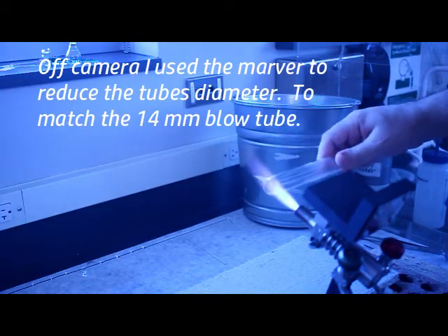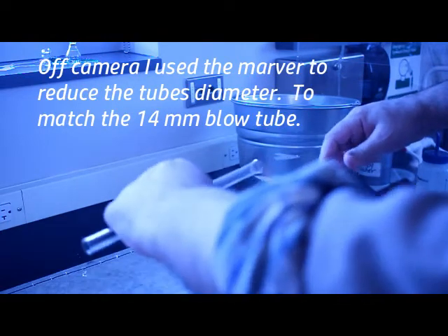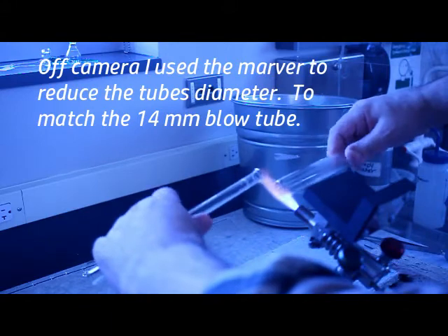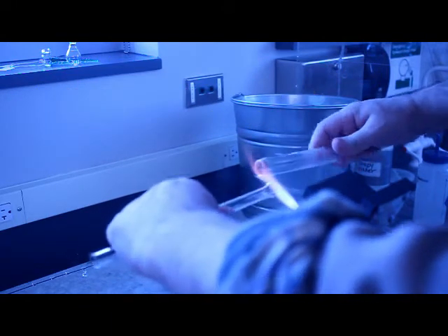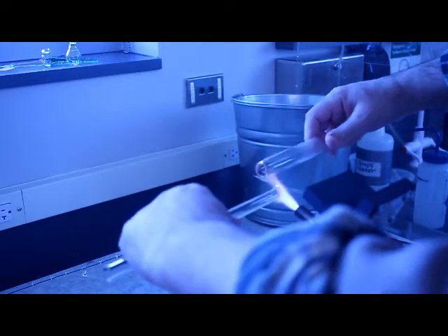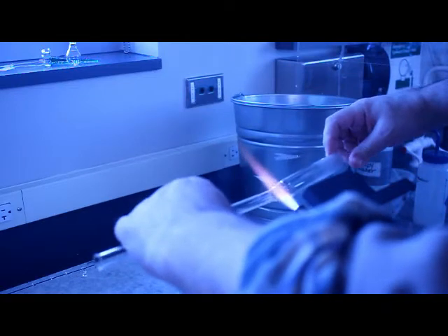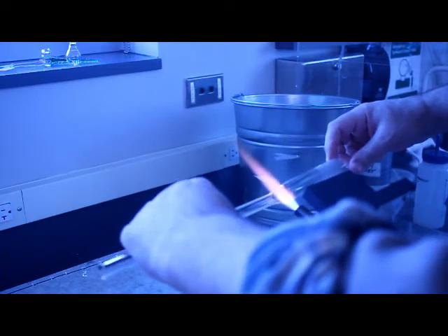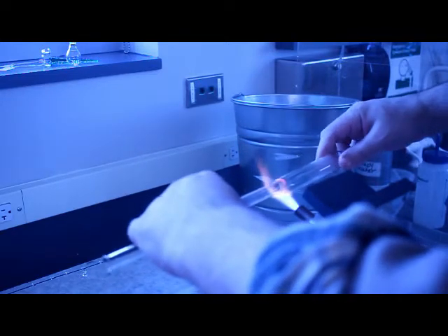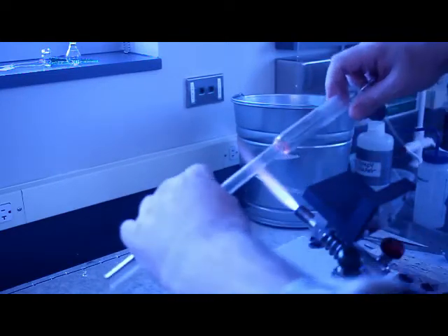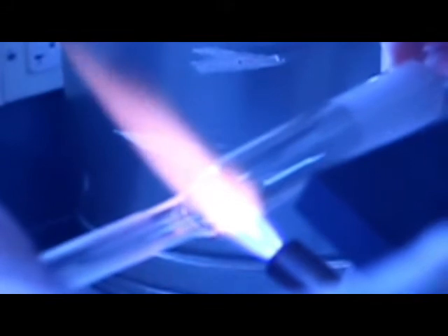Now one of the things I'm going to do off screen is after I heated that 24 millimeter tube I used the marver to constrict it down. This particular video is a test video for me, seeing what I can and cannot get away with as far as getting these techniques on video. Right now I've got the camera on my left side which makes it a little bit awkward for me if I have to shift to my left without blocking the camera or just knocking it off the stand.